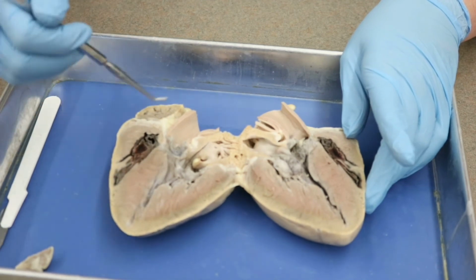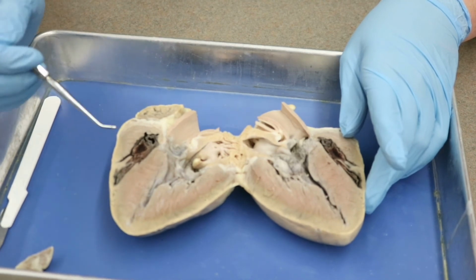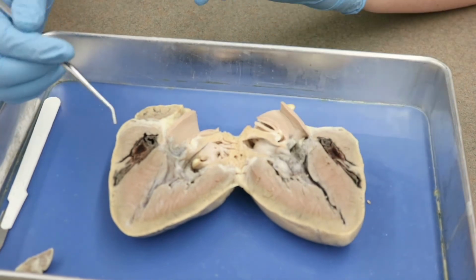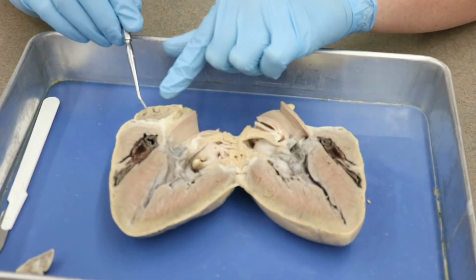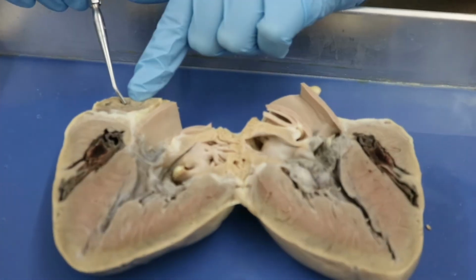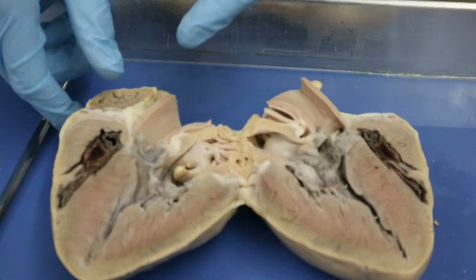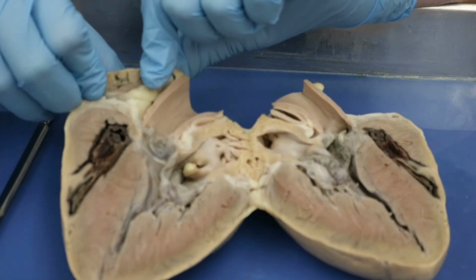As I mentioned previously, this is much closer to the size of a human heart. And there's a few very interesting features that we can see here that we couldn't really see very well on the sheep heart. First of all, this is our auricle, okay? So this is the auricle we looked at before. And this auricle here has been cut open. And let me see if I can move it a little bit with my fingers here to kind of show you.